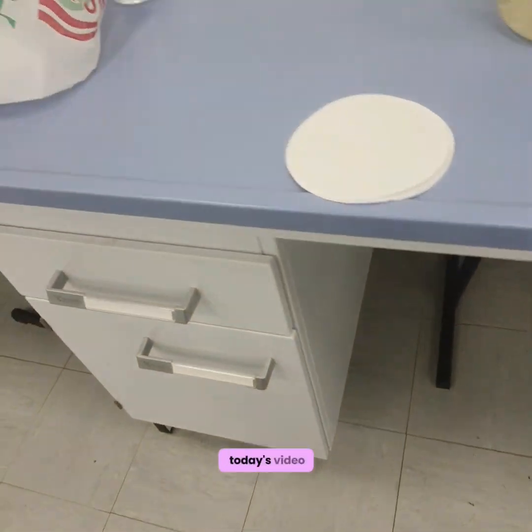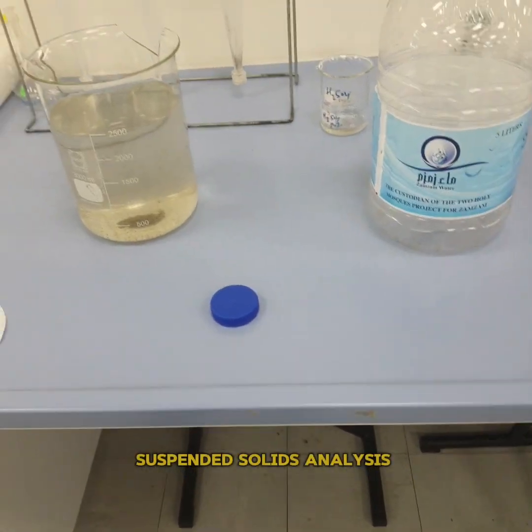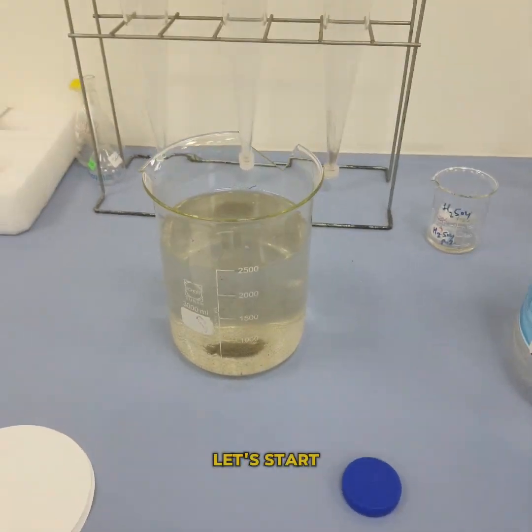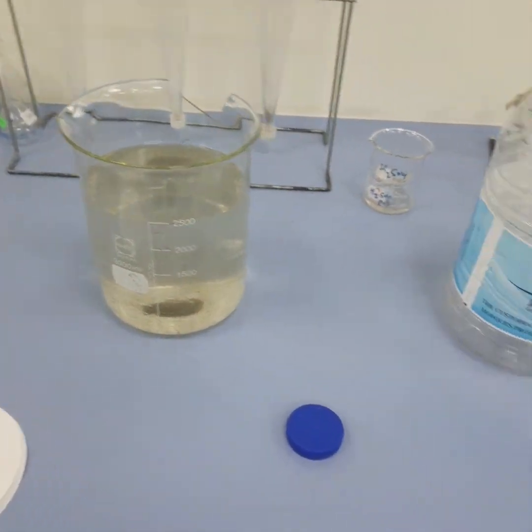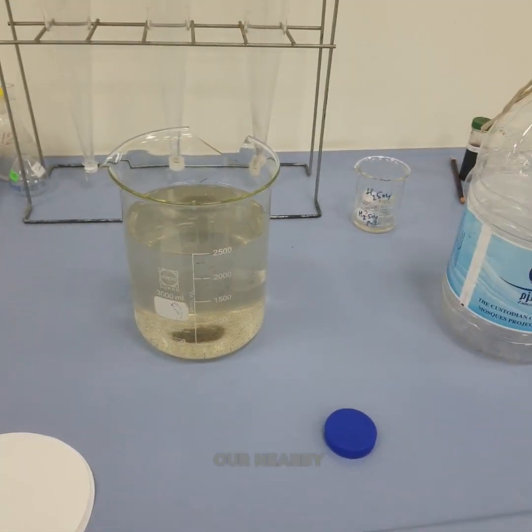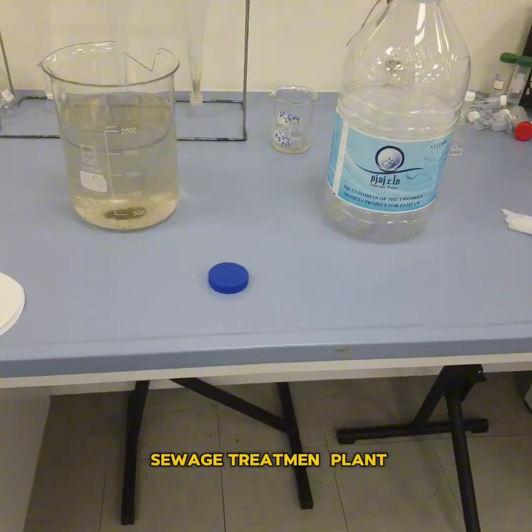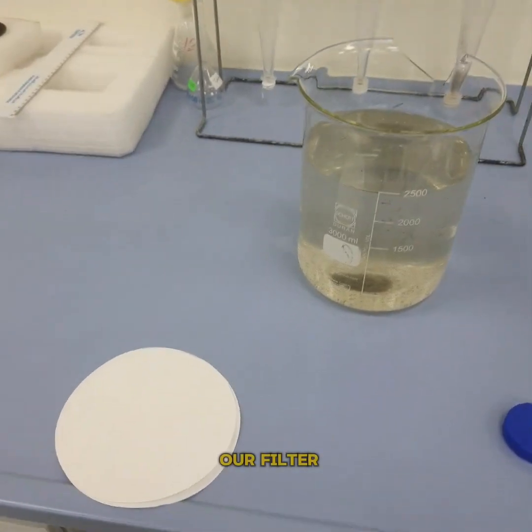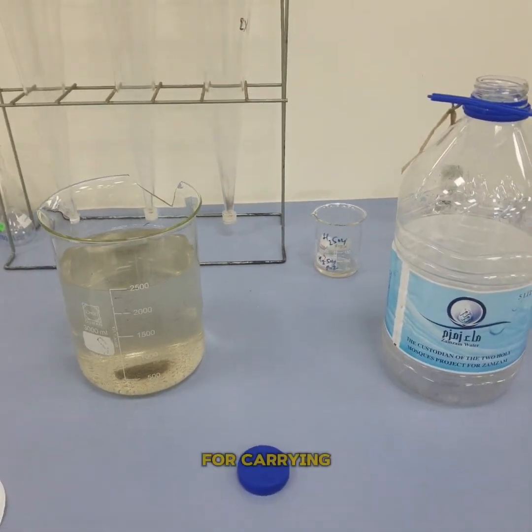Hello guys, in today's video we'll analyze MLSS. We might skip the MLVSS analysis, so let's start. First of all, we have the fresh sewage sample which was collected from our nearby sewage treatment plant. You can see there is a lot of sludge which has settled down.